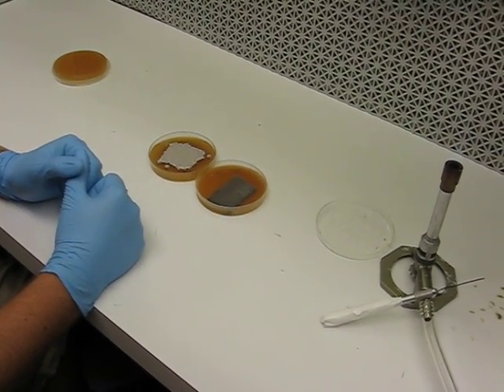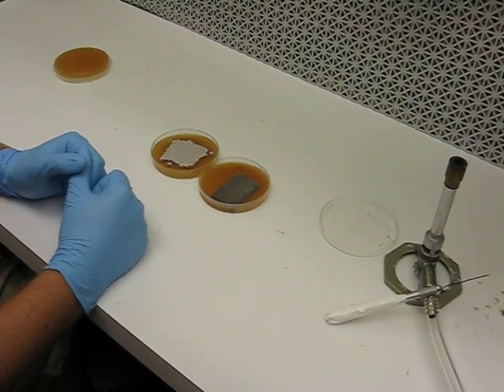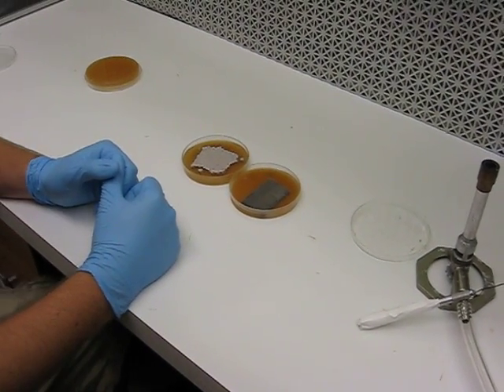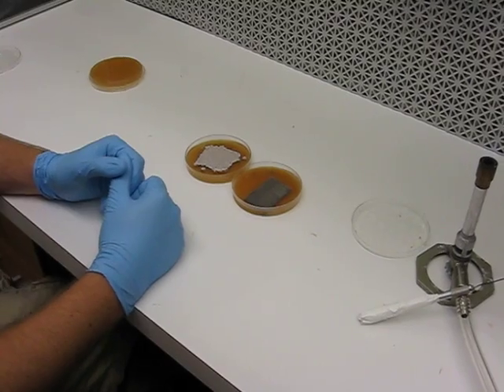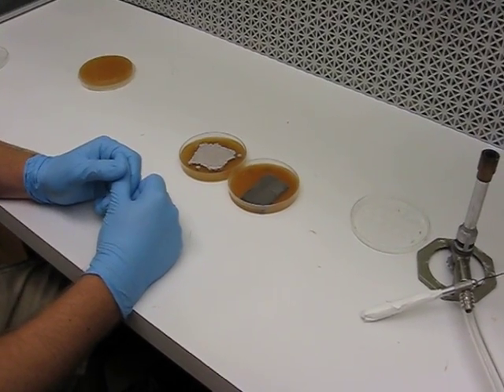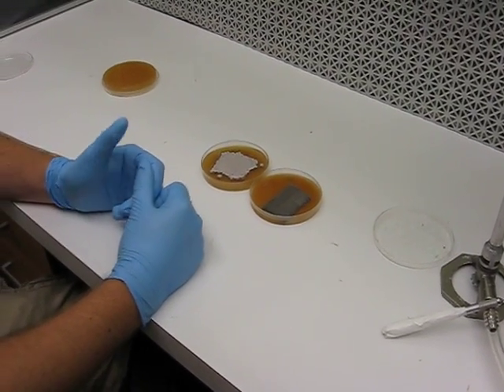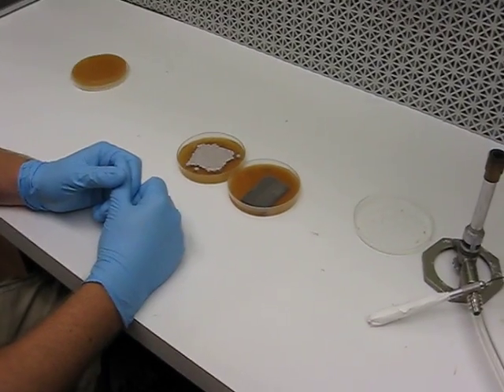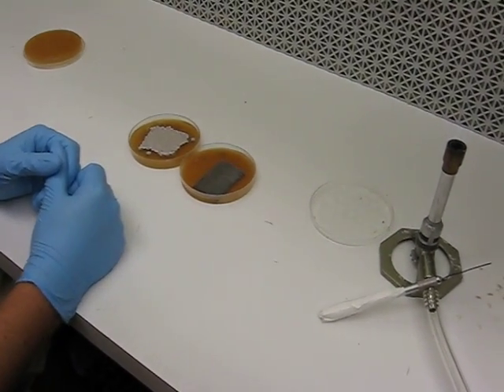During the growth period, about four days of this fungus, it doesn't grow out radially, so contamination is a major concern. If there is contamination on a plate, you have to essentially find another plate and start over, because that contamination will move on with you throughout subsequent subcultures.